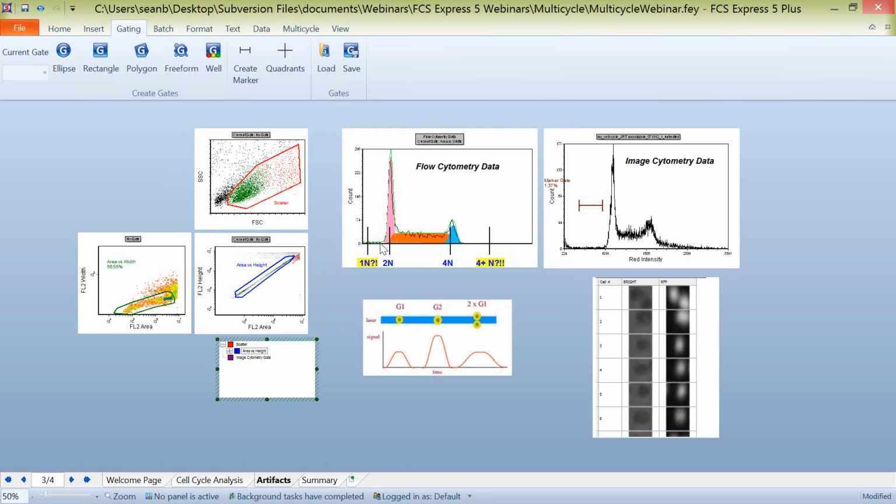The benefit of using the full version of multi-cycle as well is that any of that noise or background that's included here will be accounted for with your cell cycle modeling. So it will not be included in your results when you're calculating your G1, G2, and S phases. We're going to talk about working with those background parameters a little later as well. But you can always set some of these exclusion gates and acquire your data correctly. One of the other things you always have to discuss when working with cell cycle data is the premise of garbage in, garbage out. You need to acquire your samples carefully with the correct parameters. And if you have good data coming into your cell cycle model, you should have no problems modeling that data.